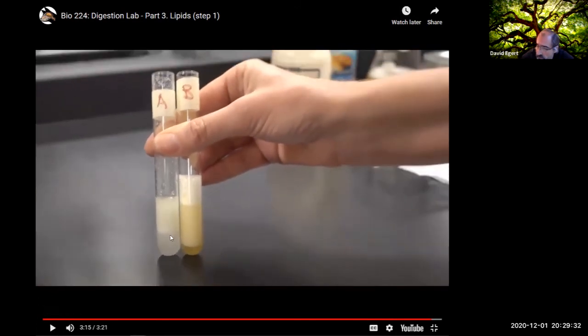So do you all see here? This is oil and water by themselves. After a few minutes, it's basically separated. The oil's back on top, the water is on the bottom. Here, there's this huge area, and this is the emulsification layer. This is where you have little droplets suspended in the water phase. And then this has also got kind of just suds on it. This is kind of like a detergent. So it's all getting foamy.